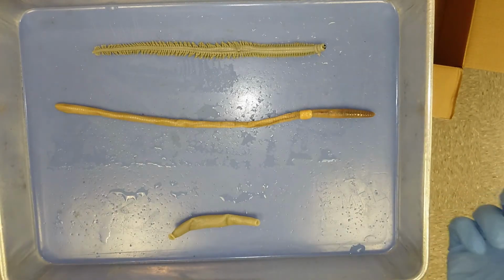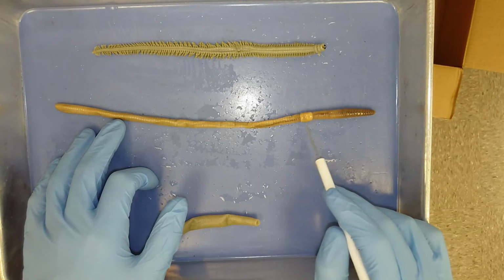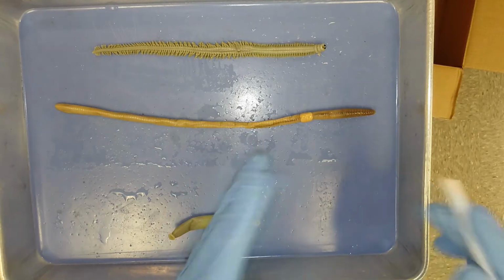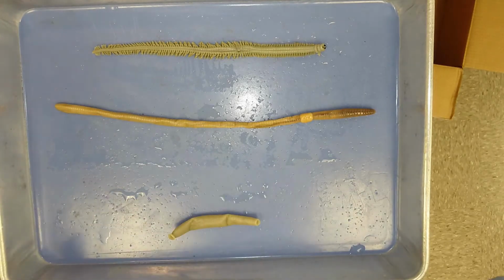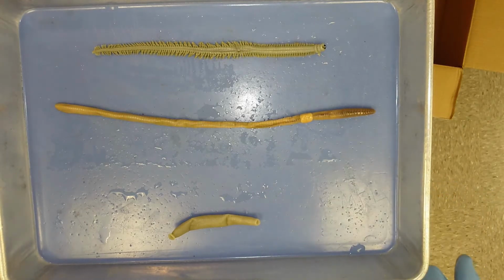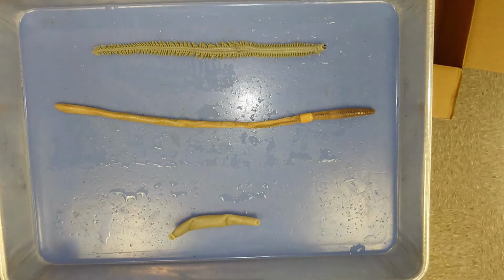To figure out which side of this organism has a head, you look for this fatty structure right here. This is the clitellum, and this aids in reproduction. The side of the body with this clitellum that's closest to the end, that's the anterior side, the front side. From there back is what we consider the posterior. So if you want to think about it in super general terms, from the clitellum up is the head of this organism. Its mouth's right at the tip here, and at the far end here we have an anus.